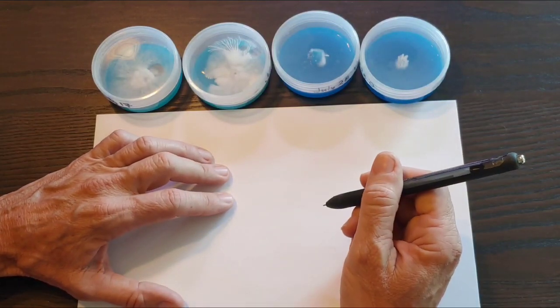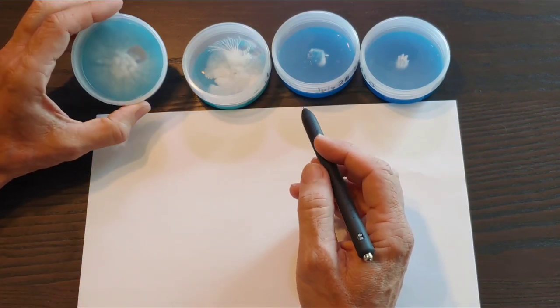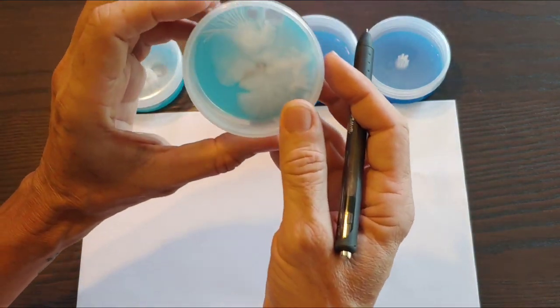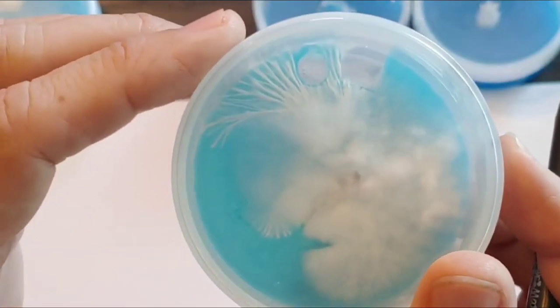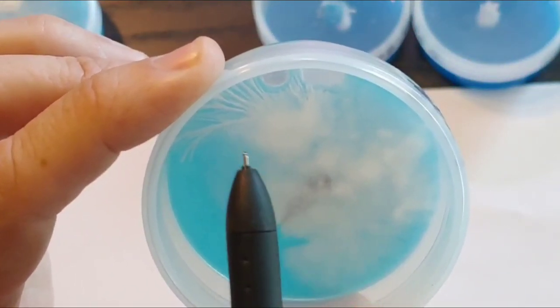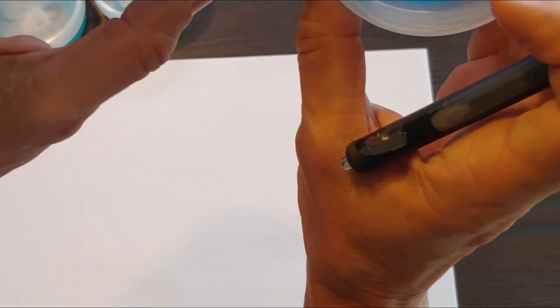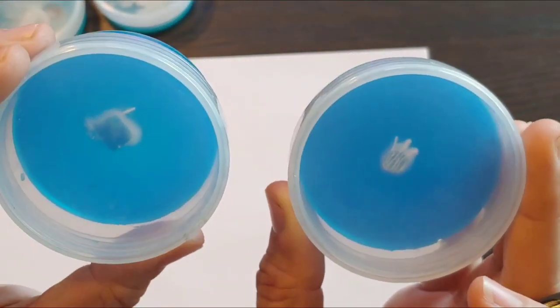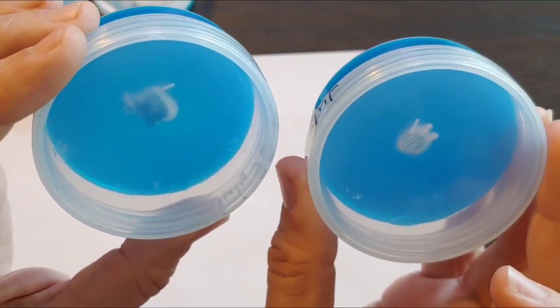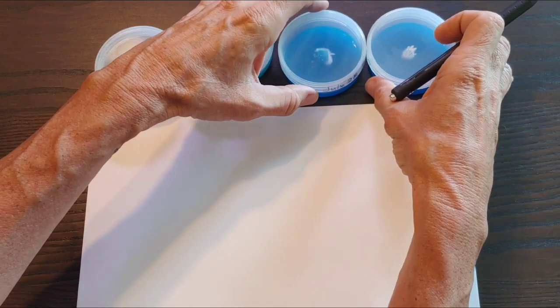All right. I want to explain a couple things about agar transfers and a couple tips and tricks. So, in one of our videos, you saw us take some agar from here and here with an X-Acto and our handy dandy tool. Then we went to here. This is just the third day after the transfer. Look how they're doing.